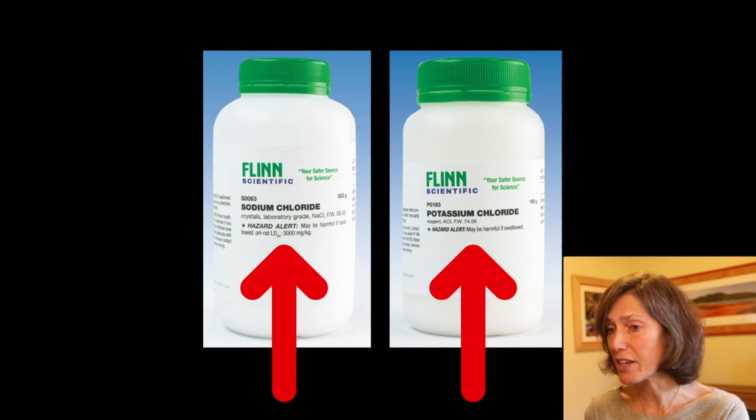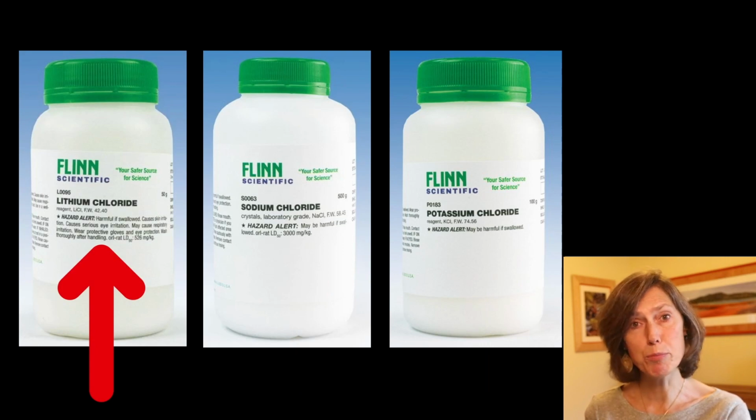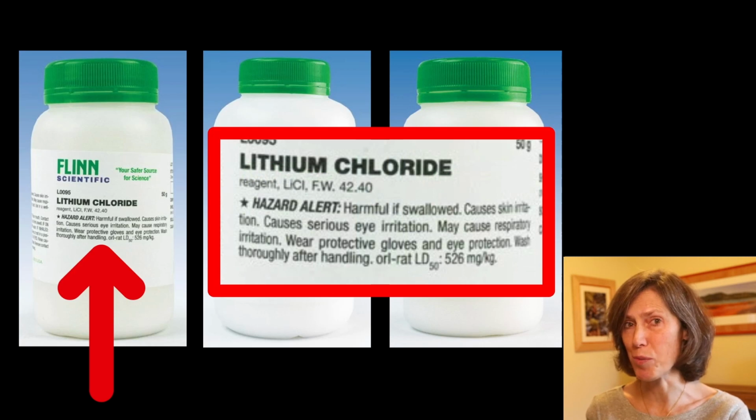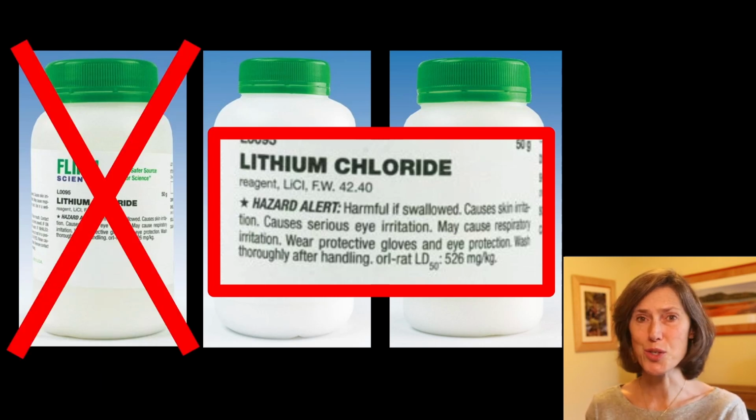May be harmful if swallowed. Sounds relatively safe. Another ionic compound that I was able to pull off the shelf is lithium chloride. Let's read the hazard alert for this one. Harmful if swallowed. Okay, we weren't planning on consuming it. Causes skin irritation. Causes serious eye irritation. May cause respiratory irritation. Wear protective gloves and eye protection. Wash thoroughly after handling. And then the oral rat LD50, 526 milligrams per kilogram. I chose not to use this salt.